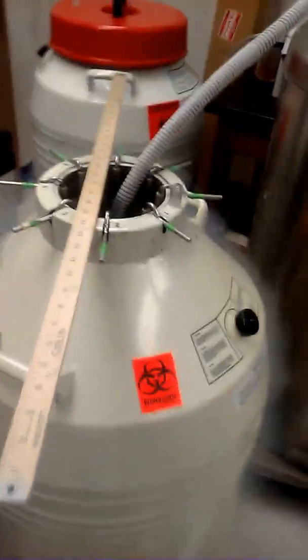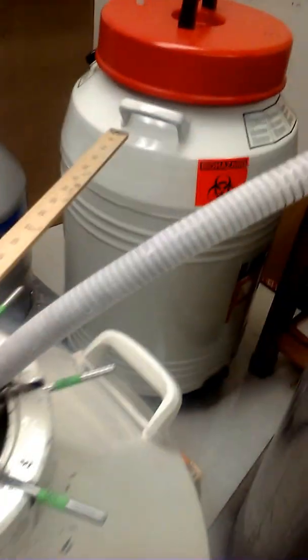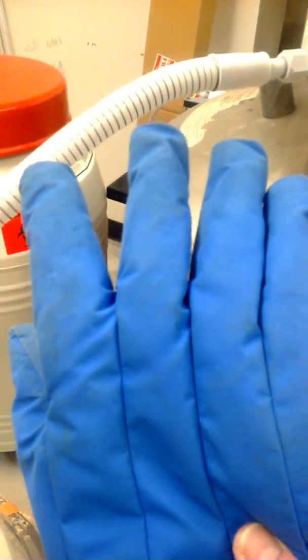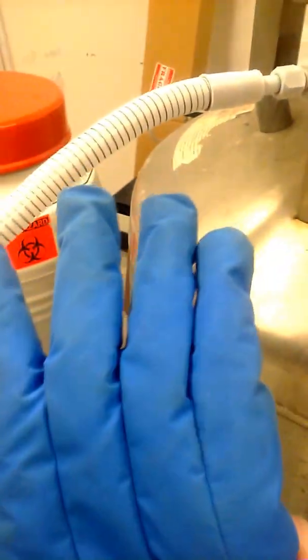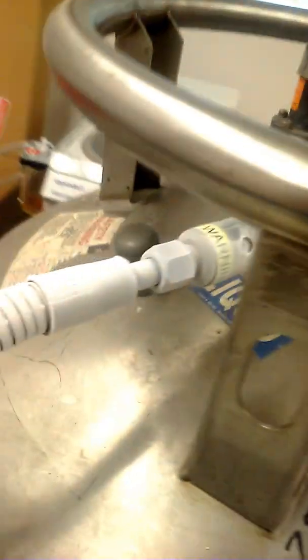This is how we fill liquid nitrogen tanks. You need to use proper gloves for safety, add goggles on and a lab coat.